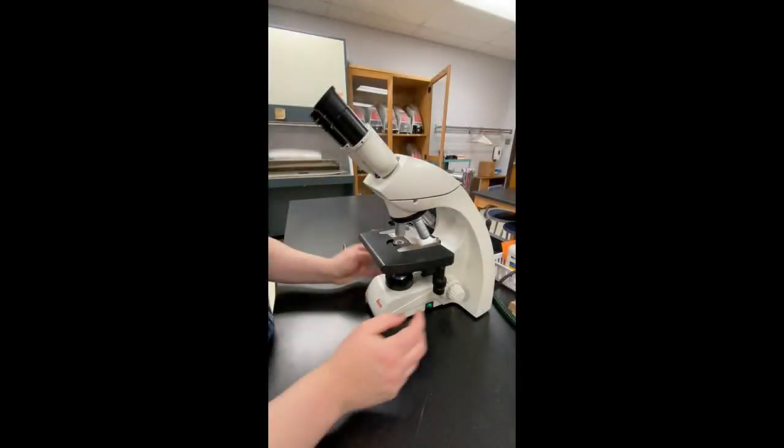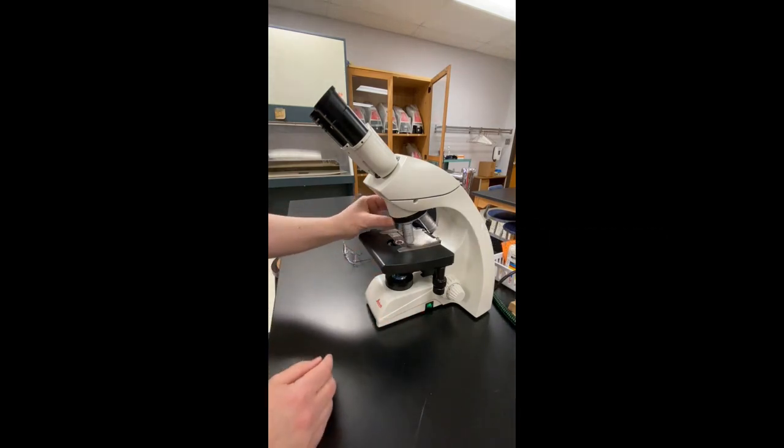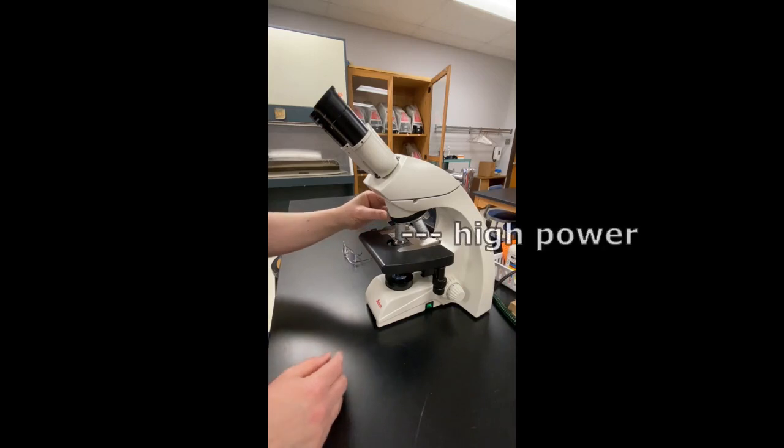In part 1, we operated the microscope to get a view of the sample through the low power lens. Now we are switching to the next objective, which is the high power lens. The high power lens has a magnification of 40 times and a blue line.